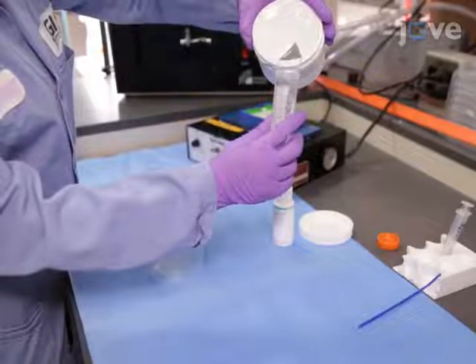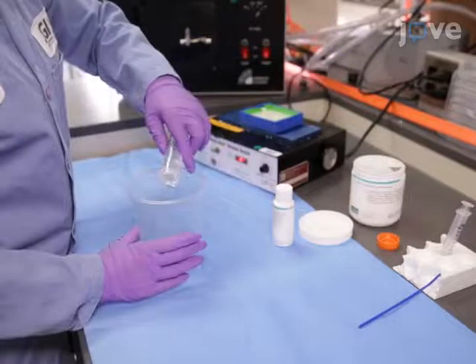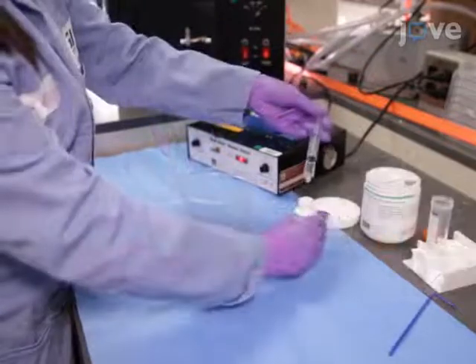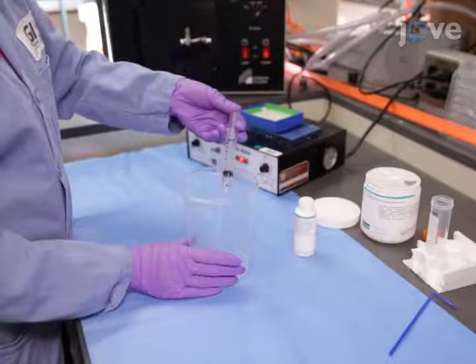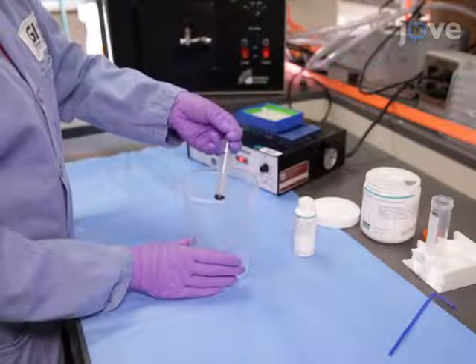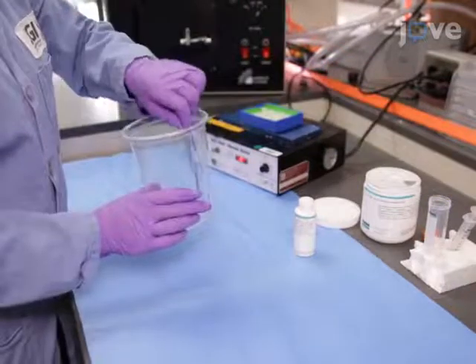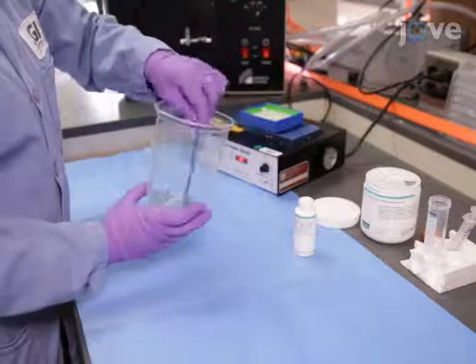Following the construction of EcoFAB molds using 3D printing according to the text protocol, in a disposable 1-liter container, mix 40 milliliters of siloxane elastomer base with different volumes of curing agent, depending on the experiment.